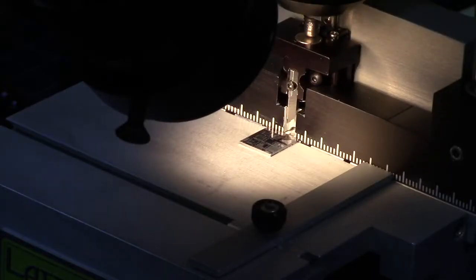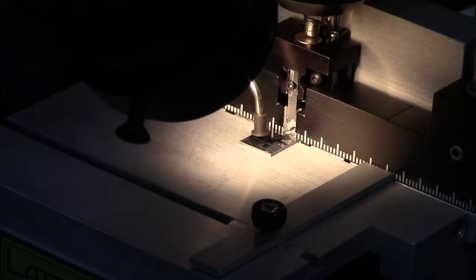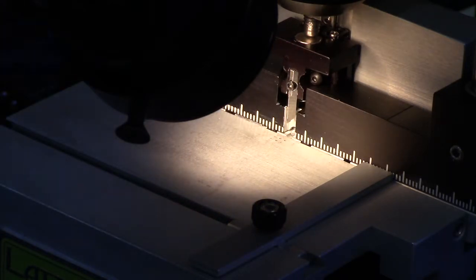So here is my indent. Now I'll use my vacuum tweezers to pick up the sample, so I don't touch it. And from there, I'll grab it with my tweezers.